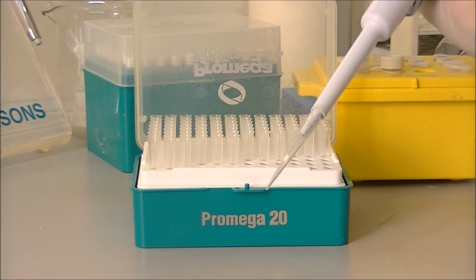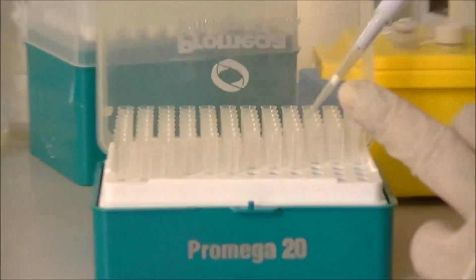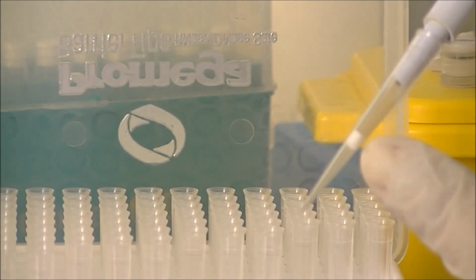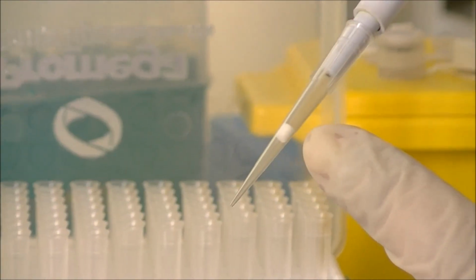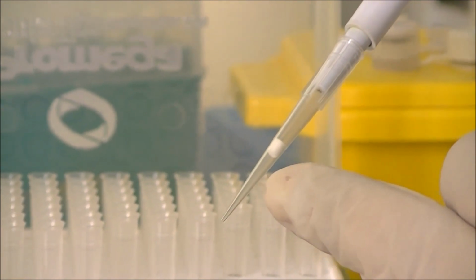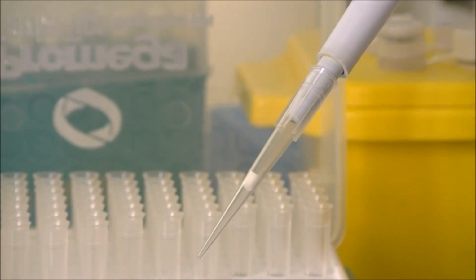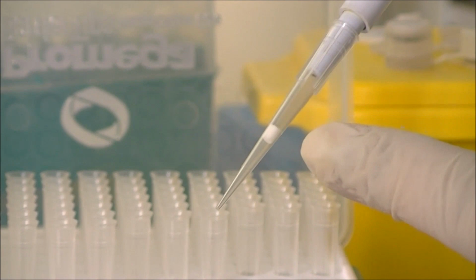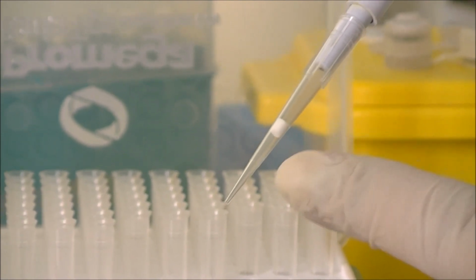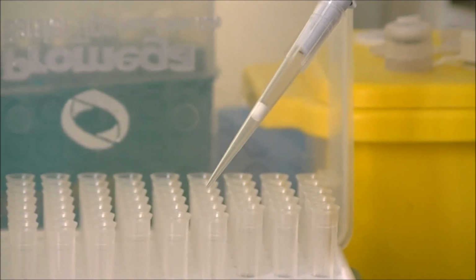with the micropipette. This micro tip contains a special barrier right in the middle of the tip barrel. This type of barrier tip prevents any aerosols that are generated while aspirating the liquid in from getting into the barrel of the tip. Using this type of barrier tip is very important for us to prevent sample cross-contamination when we are setting up the PCR.